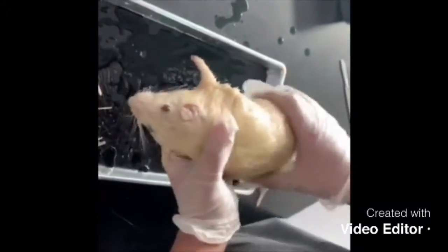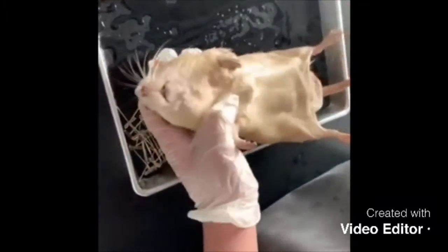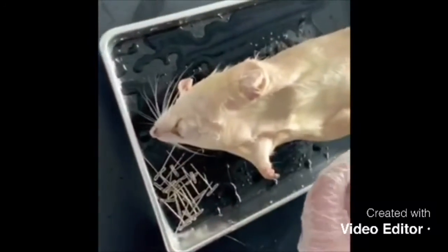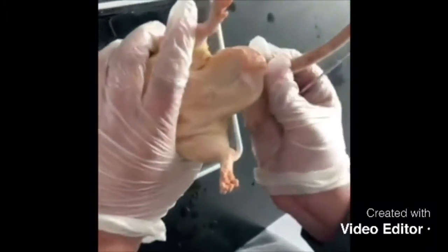Another external comparison between the rats is the teeth. Rats do contain teeth on both sides to chew and consume food, while frogs do not contain teeth on the lower jaw. But on the upper jaw, frogs do contain teeth, but basically in the frog, the teeth are useless. And the biggest external difference is that rats have a tail, and frogs do not.